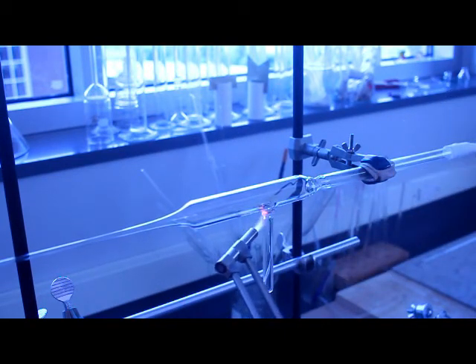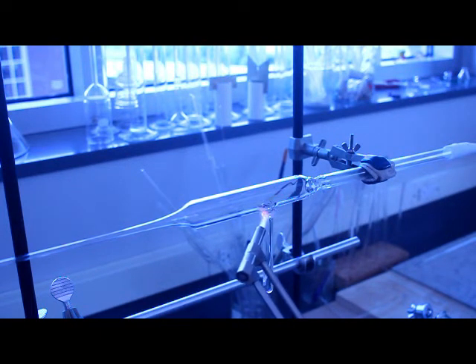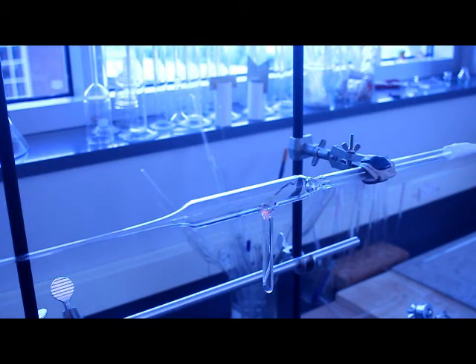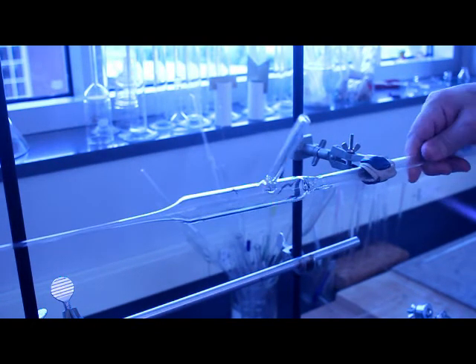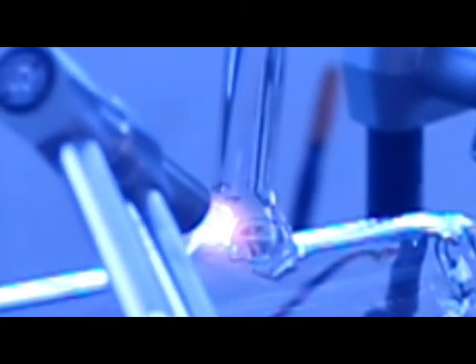This torch I'm using, this hand torch, is brand new. It's a Bethlehem surface mix torch, it's an absolutely fantastic torch. I am not doing it justice right now for how bad this weld is. So this is a case where I have an excellent set of equipment for glassblowing, now I just basically need to get better to fully utilize them.